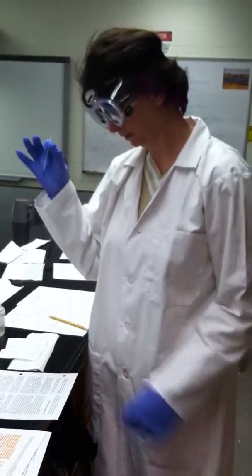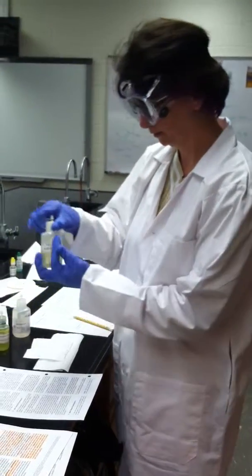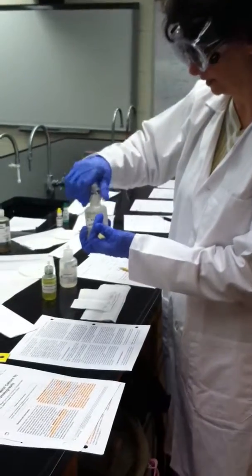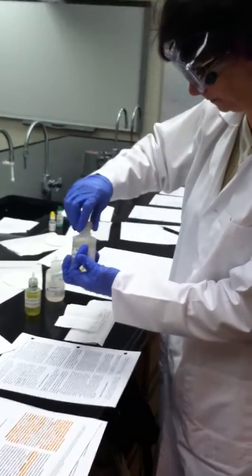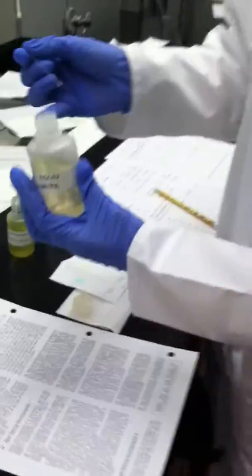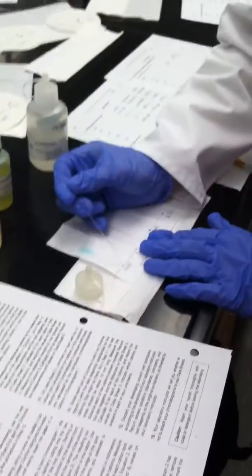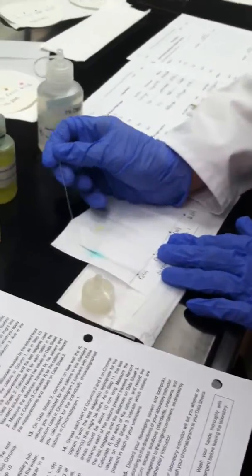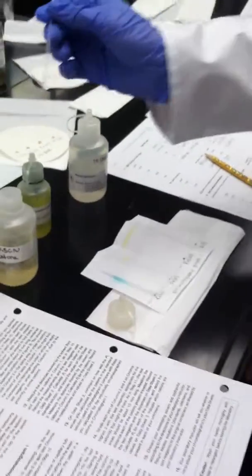We're going to use our capillary tube with our reagent that we tested and said what's the best for cobalt. We dip it in, we drag it up quickly until we get to the center of the spot so that we can measure it.